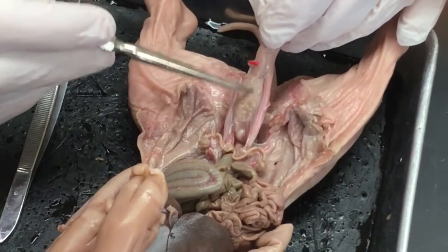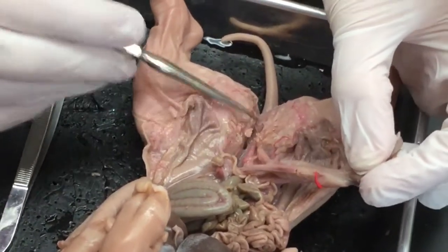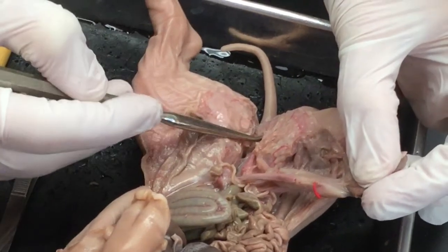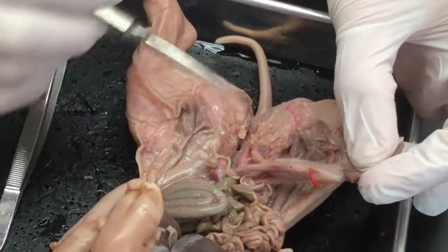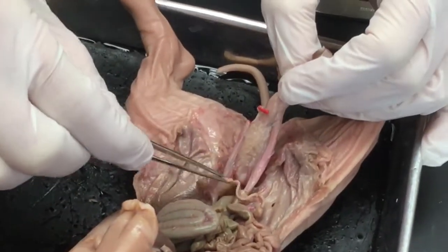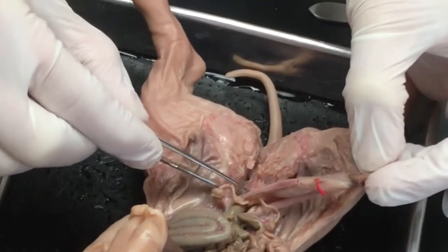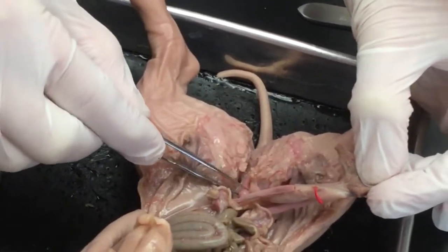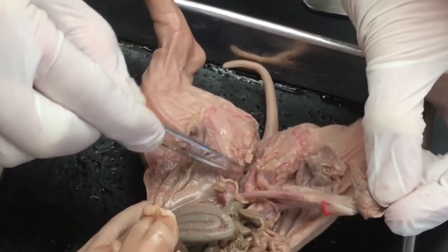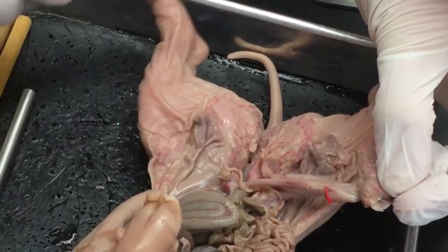This right here, this is my bladder. It's leading to the urethra. The urethra comes down and it exits out of the urogenital sinus down here. Fallopian tubes unite with the uterus where the growing embryo would be, and that leads us down to the vagina. So the vagina is here, the urethra is there.